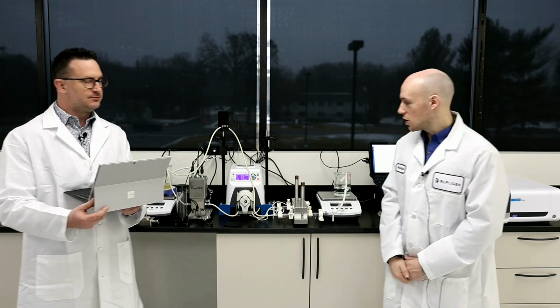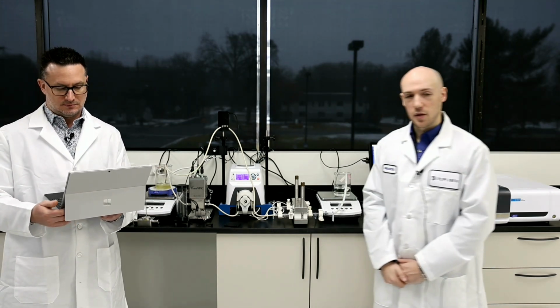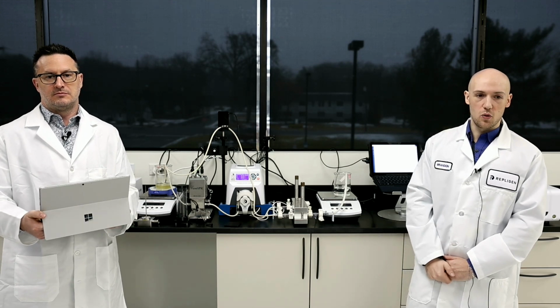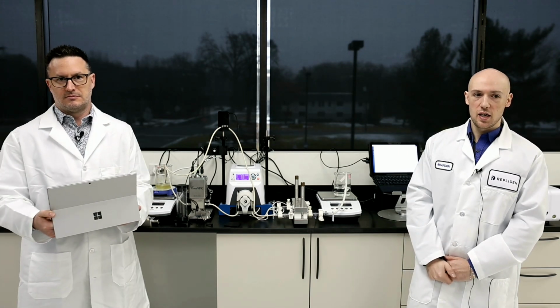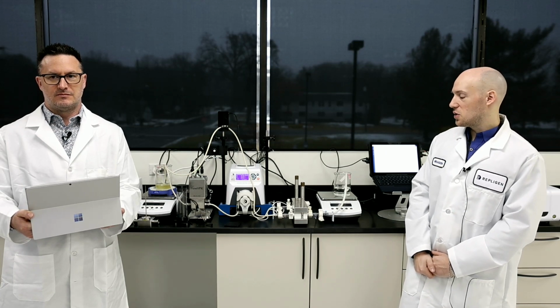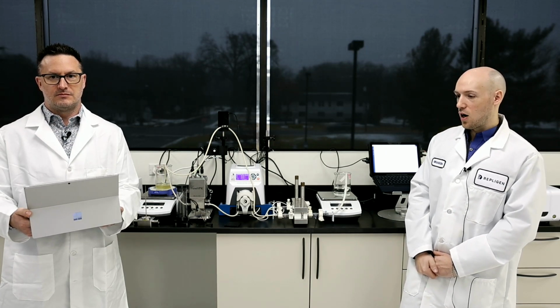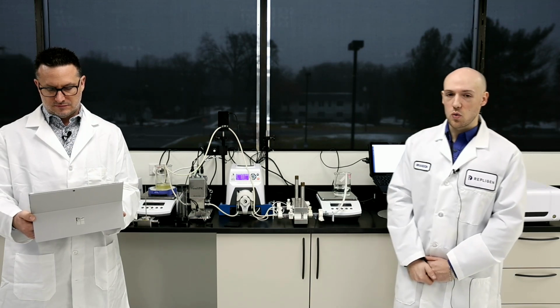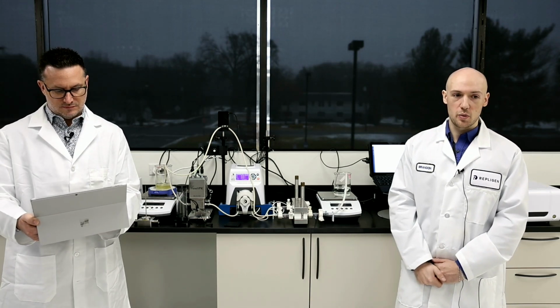Yep, so of course, the Flow VPX has the ability to do background measurements. You would just have to run, say, your buffer or whatever you want to baseline first. Then it's going to store that into the system and then use that to get concentration based off of that baseline. However, we are slope-based, so we do slope spectroscopy.